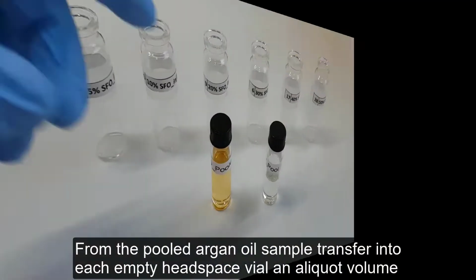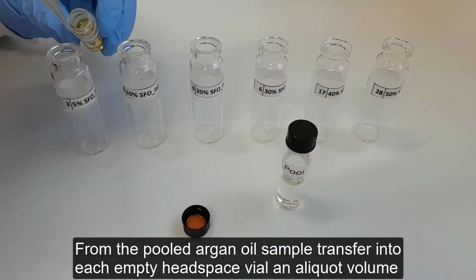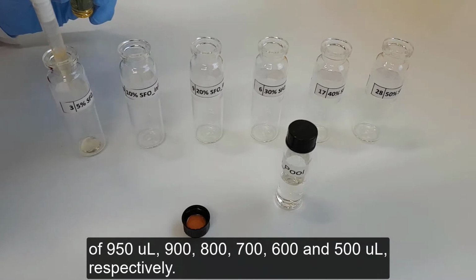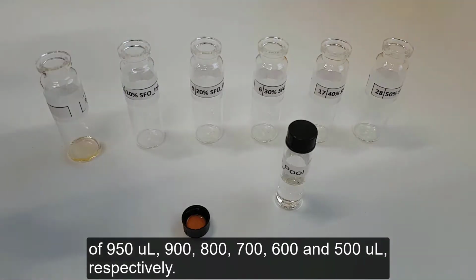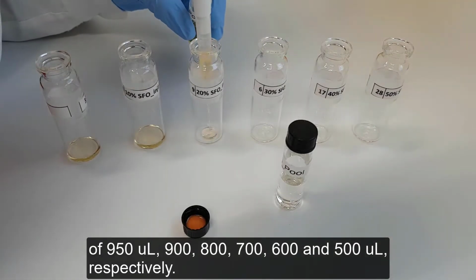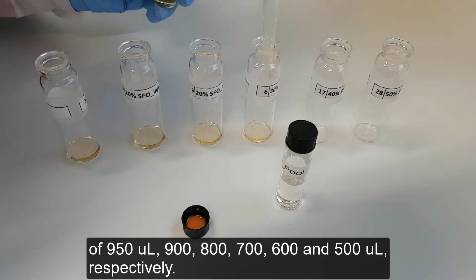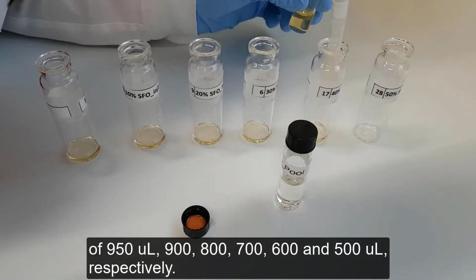From the pooled argan oil sample, transfer into each empty headspace vial an aliquot volume of 950 microliters, 900, 800, 700, 600, and 500 microliters respectively.